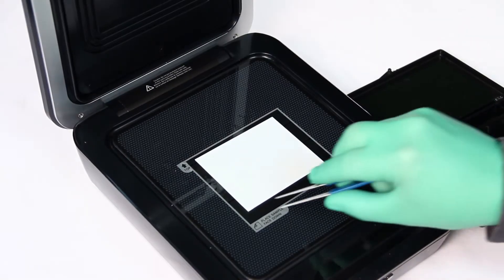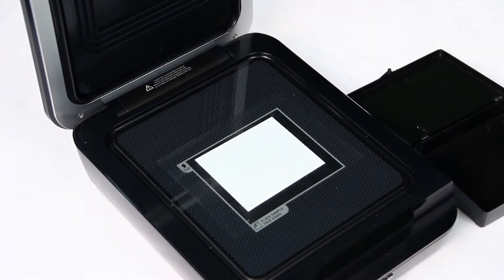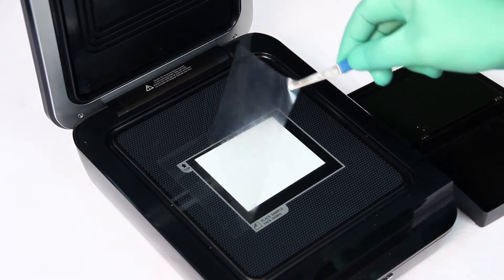Under normal circumstances, the blot will not dry out in the time it takes to acquire an image. If you would like to keep the blot wet for an extended period of time, you can add a sheet of plastic on top of the blot.